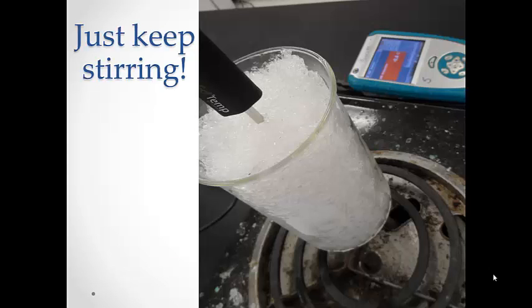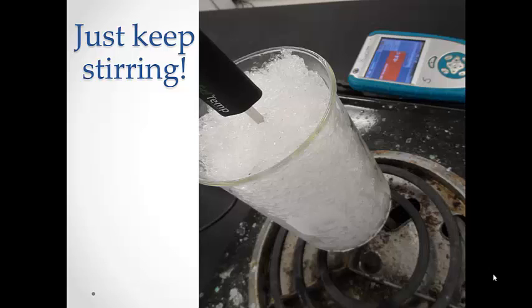Once you have your experiment set up, hit the start button and begin heating. Remember that if we are using these hot plates, they are very, very hot. Keep them set on low. You also want to stir the ice with the temperature probe until it is completely melted.